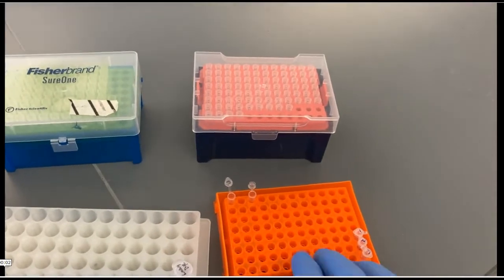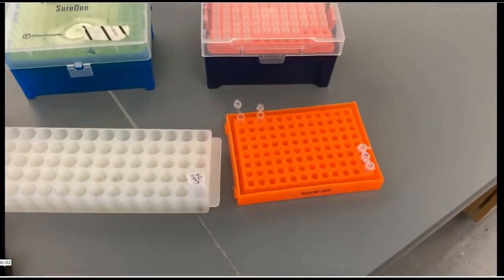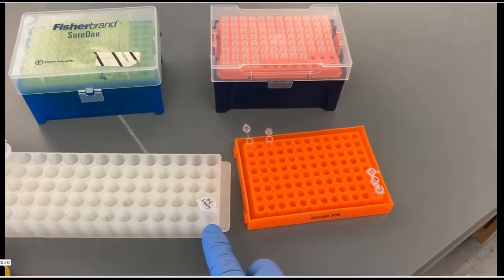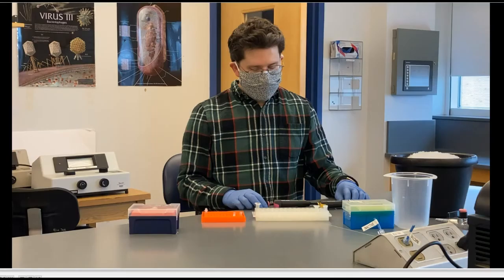And then in this small rack here we have the two tubes in which we will do the PCR reaction. For now we can ignore this tube — this will be a loading dye for when we run the gel. And here Tim will show you, working with Caitlin, a student in our lab, how to actually set up the PCR reactions.